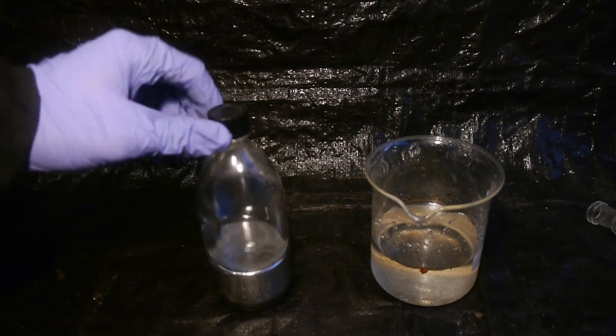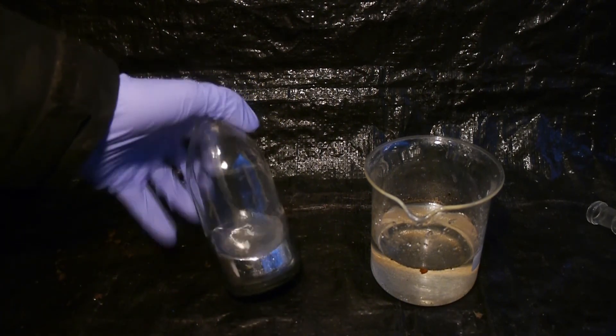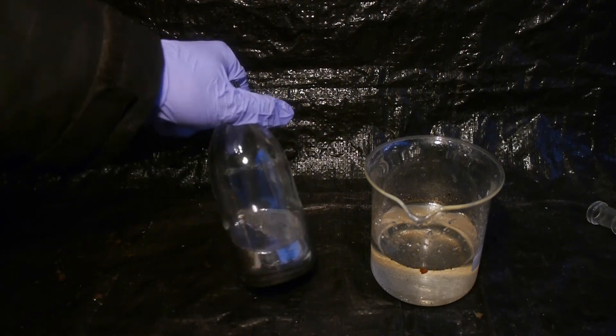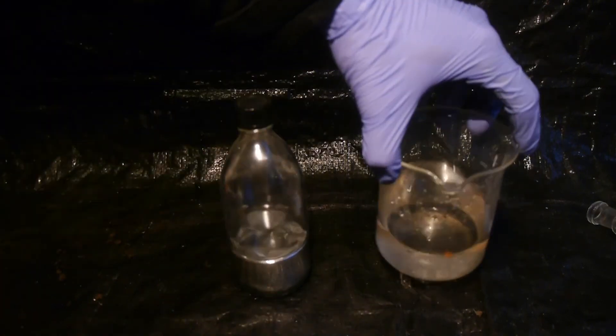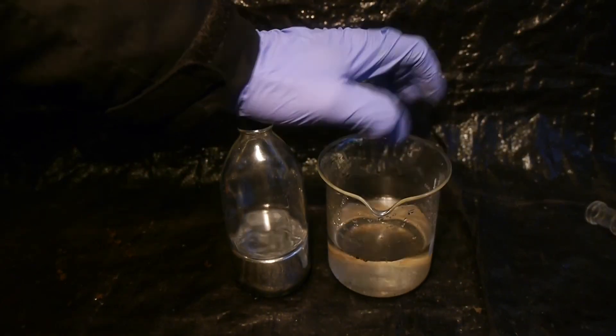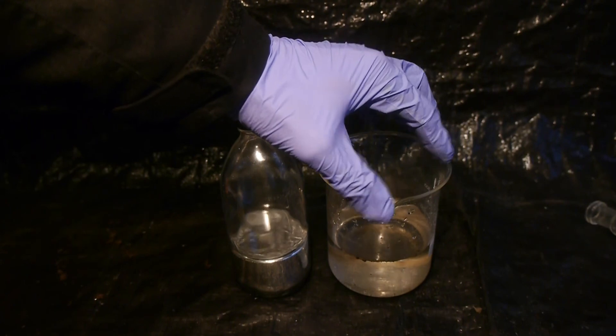So here are the results of the investigation from this mysterious mercury liquid. So now we have got some very pure and shiny looking mercury metal. Which is awesome. And then we've got here this flask containing a deadly solution of mercury nitrate. And I will have to turn this back into mercury metal. For safety reasons and because I have practically no use for mercury nitrate.